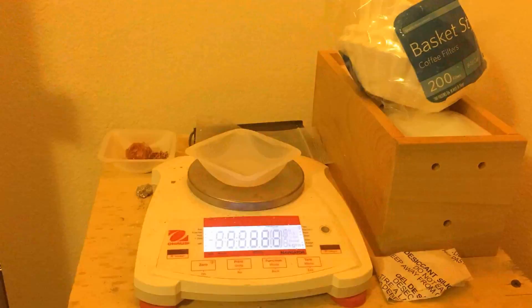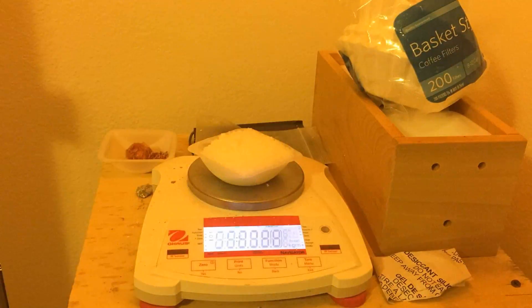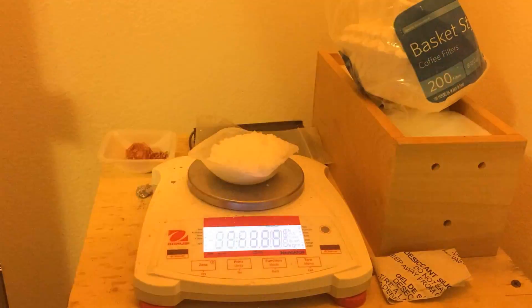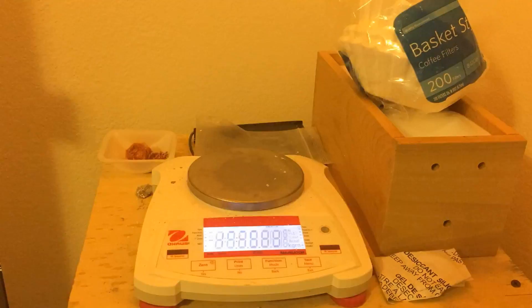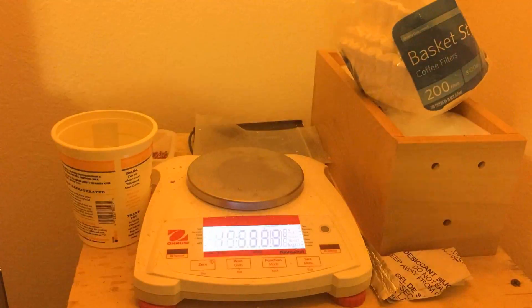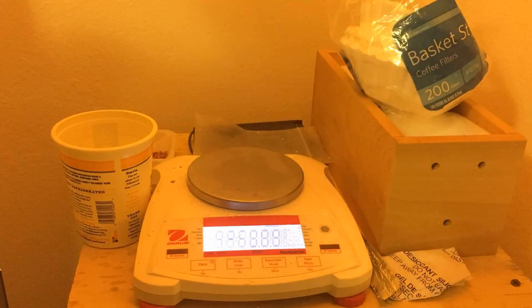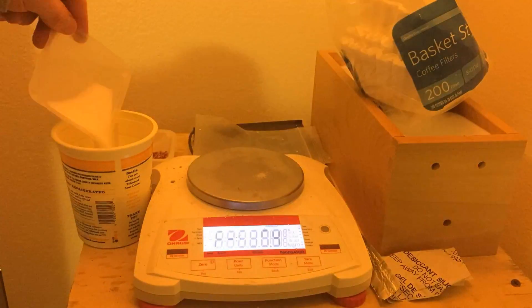You'll see that as I was weighing out the ammonium nitrate and potassium chloride, I had to do a lot of small individual weighings. This is because the max weight on my scale is about 200 grams. I didn't want to overload it. This ended up taking quite a while.